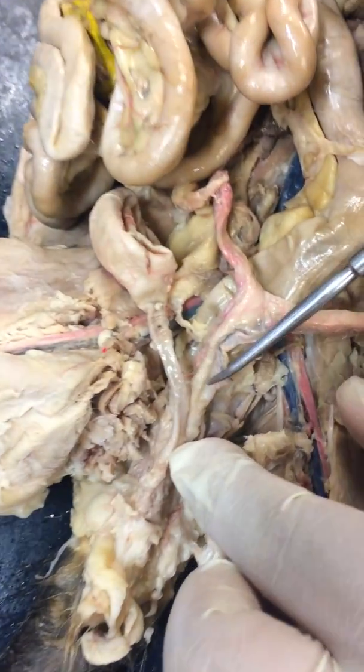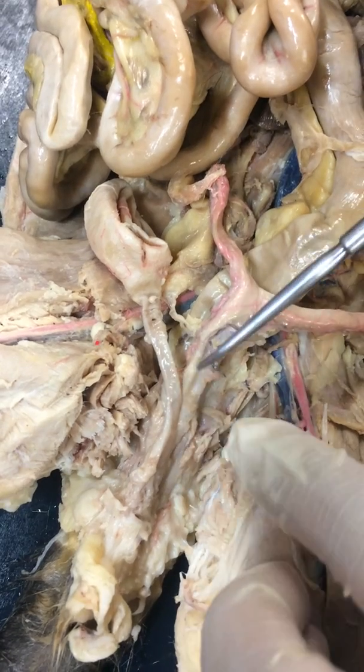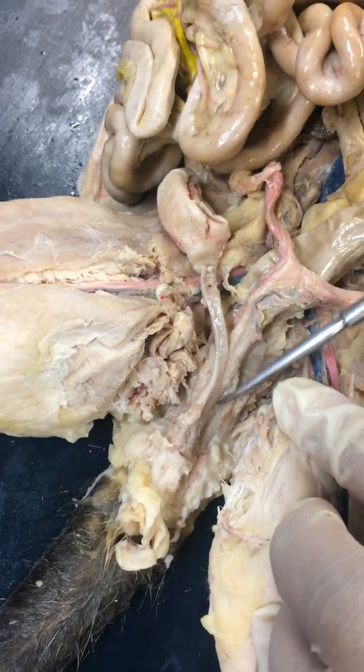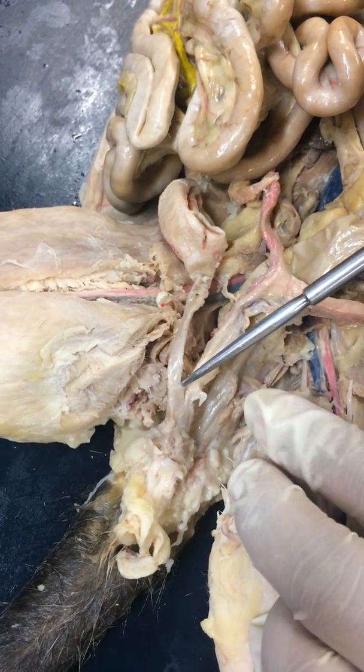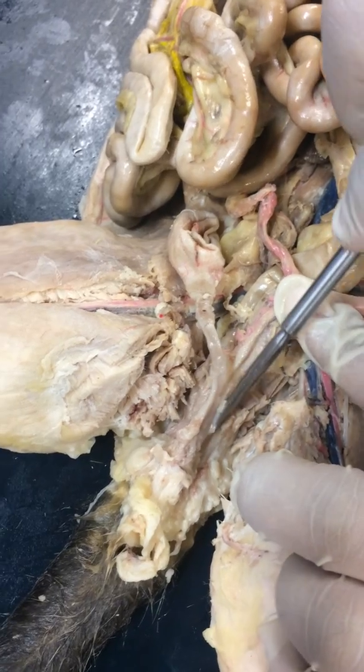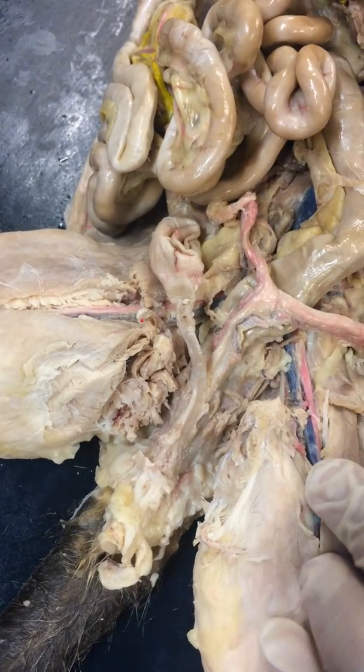You kind of have to feel around here. Right here you feel a bump. That's the cervix, which means that's the end of the uterus, or the opening into the uterus. Below that cervix is where you have your vagina. So the vagina then is the rest of the tube that you're seeing back here. Right? And then of course that exits out to the vestibule.